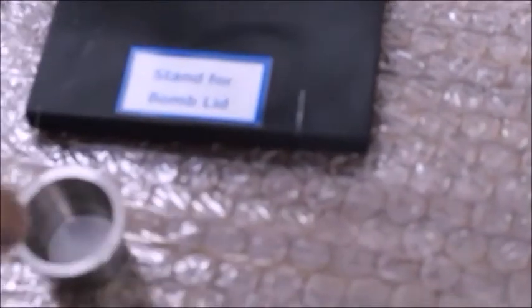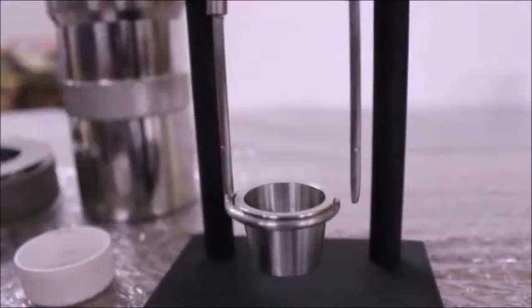This is a crucible. The crucible is the device in which you will place a sample item, in this case benzoic acid. The crucible goes in the crucible stand.